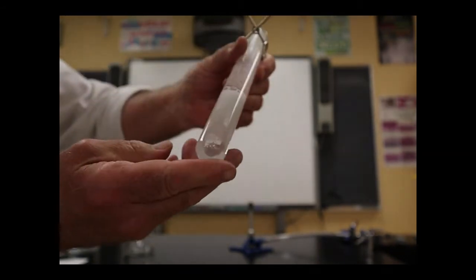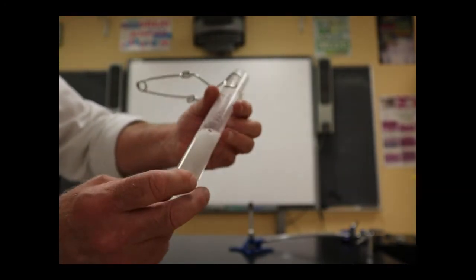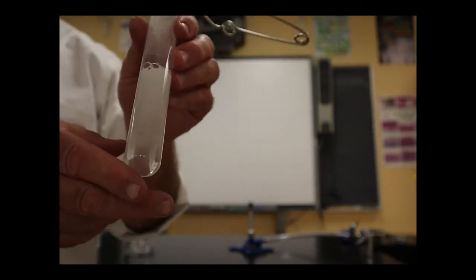Oh, look. Well, let's see. Still got some going on there. Still have some right in here. Not as much. It looks like there's just one piece left. Seems like there's a lot of bubbling going on there.